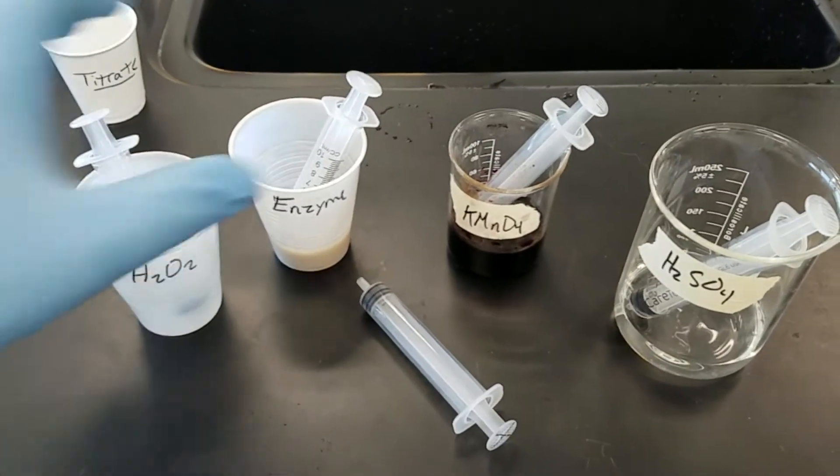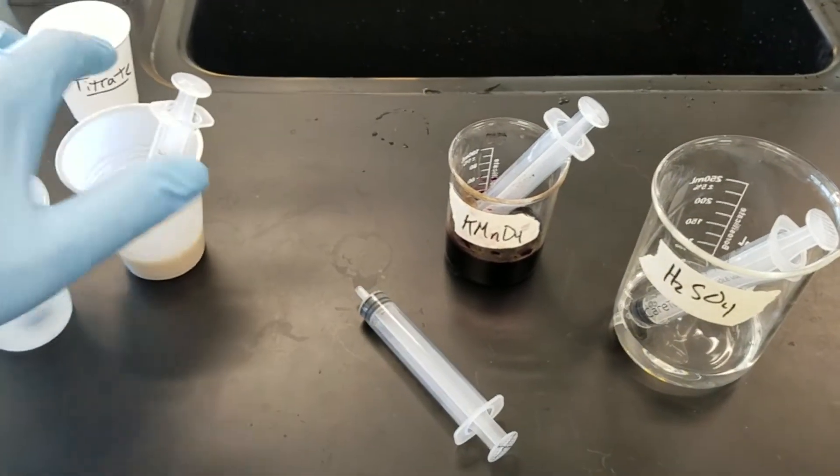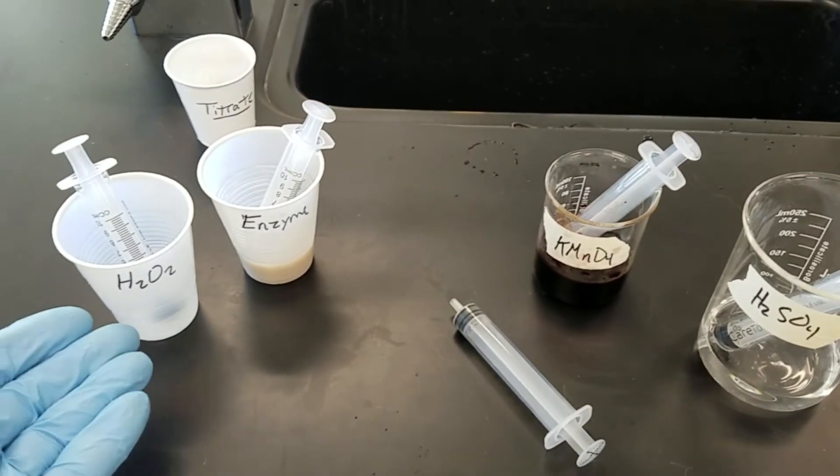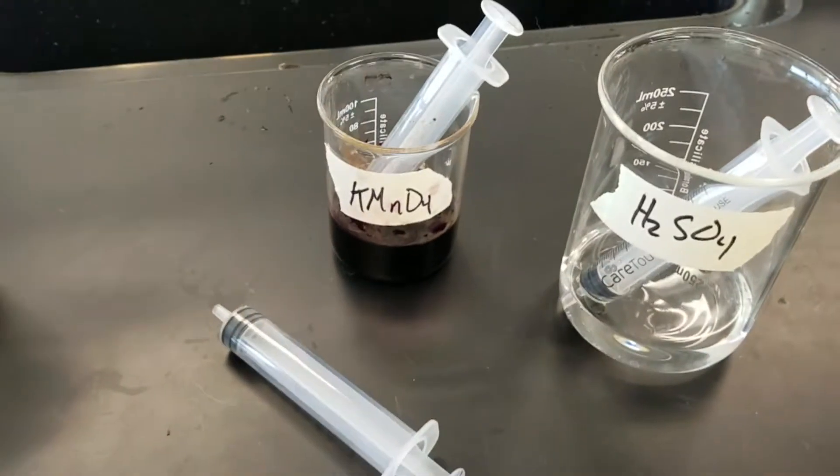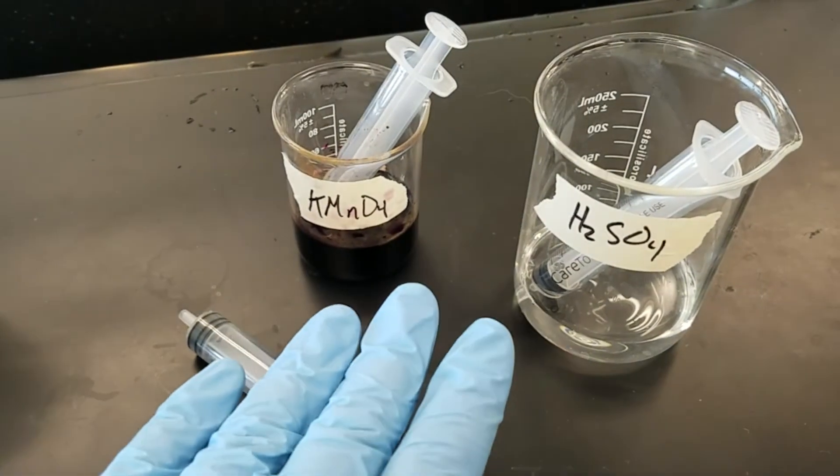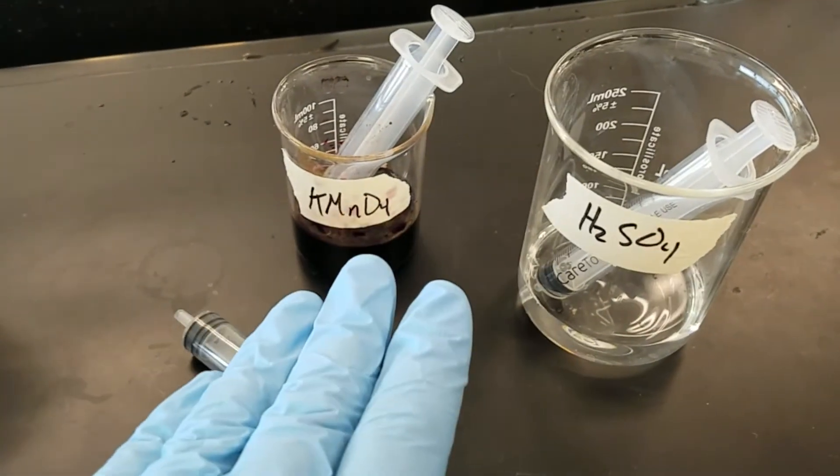But one thing to mention is these two are not so dangerous. It's just an enzyme and peroxide, if you get it on you, not a big deal. These two on the other hand, please keep these in the tray at all times because if they spill you're going to have a bad time.